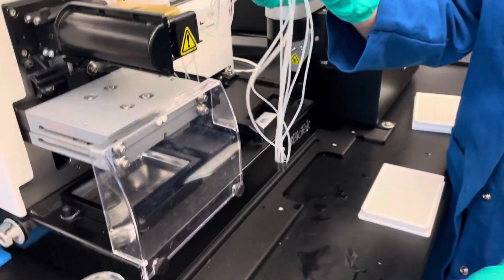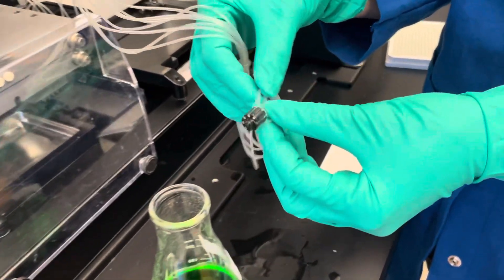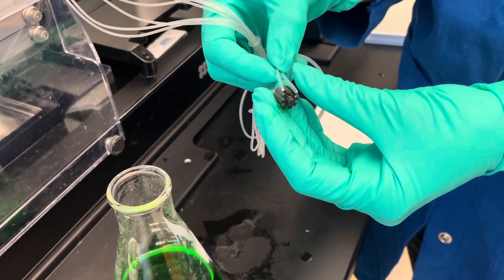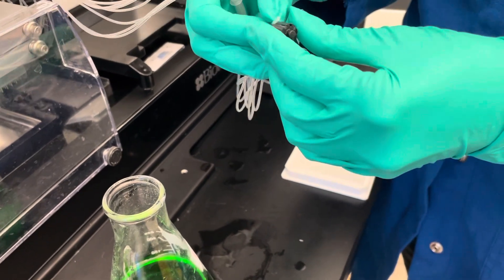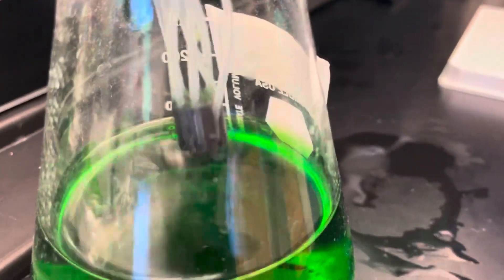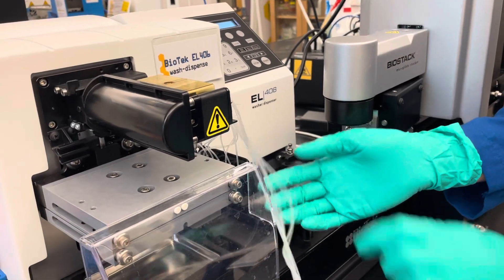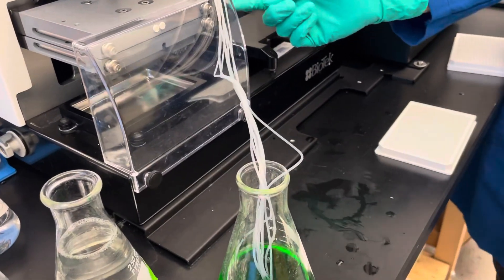Then you close over here, and this end is going to go into whatever solution you want to dispense. It has this weighted head. If you wanted different rows to get different liquids, you could remove these and put them in your different liquids. Or if you want to be more sterile, you could remove them since this little thing is harder to sterilize, but today we're going to use it for convenience. Make sure the end goes all the way into the liquid — if it was up here it would just dispense air. Also make sure the tubes aren't going to get caught in the mechanism, so pull it a little bit away.